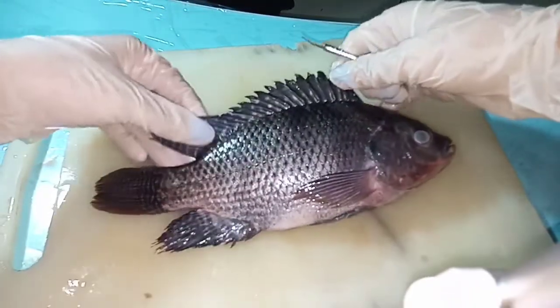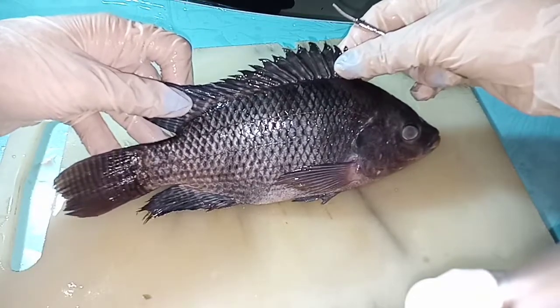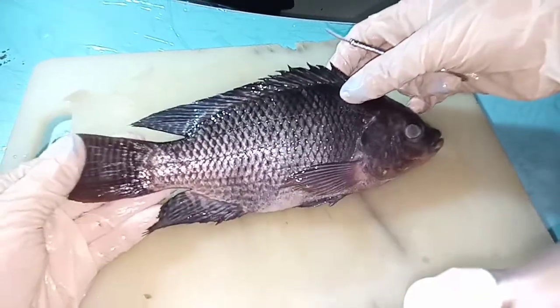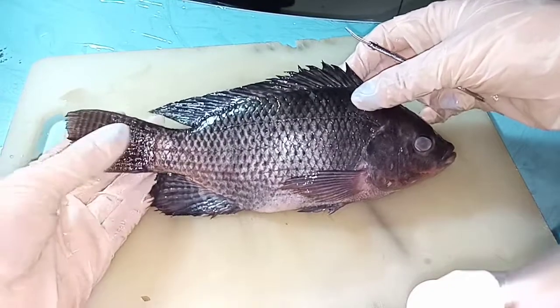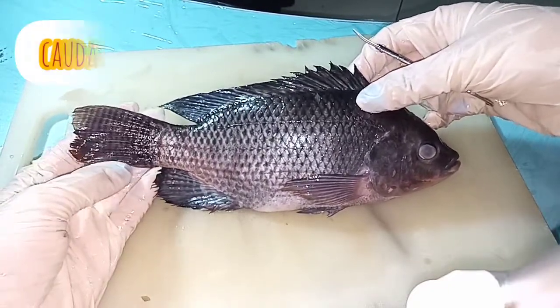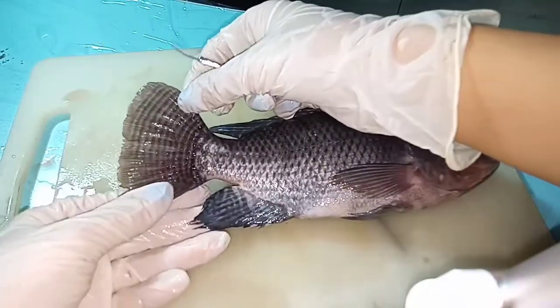That is the trunk region. Next is the tail region. In the tail region, it is not really called the tail, but it is called the caudal fins. We could see the caudal fins here.